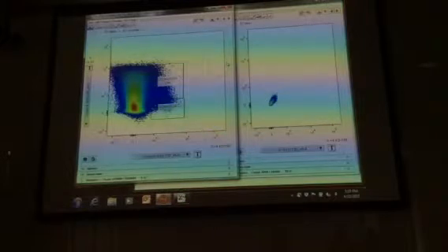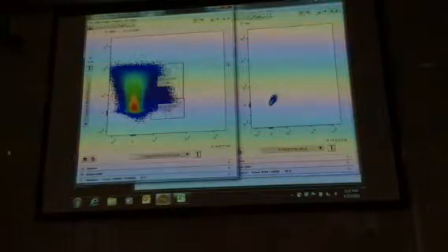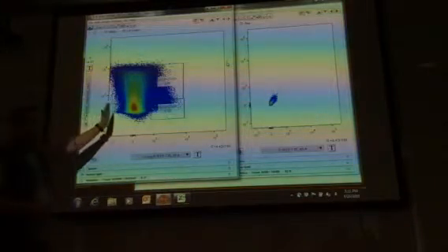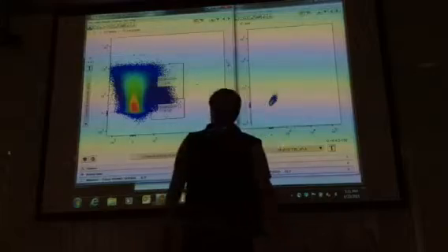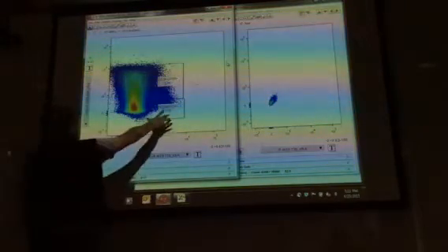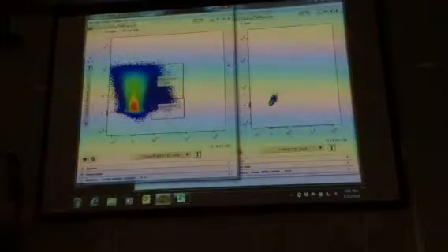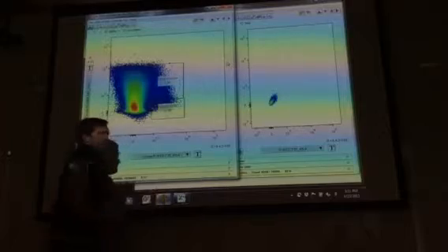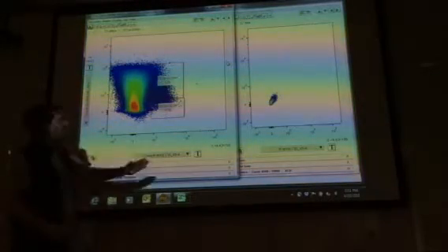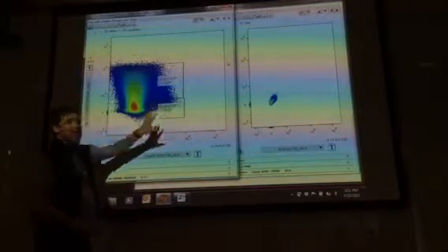Who would have drawn them somewhere slightly differently? We've drawn it a little bit more this way. A little bit more this way? Just because of where it is over here. Okay. Yeah, I mean, you can. You could take this whole thing, you could shift it over based upon that, if you really want to. If you could convince yourself that I've been a little bit less stringent or more stringent with my gate on CD34, you could move this and you could go back.